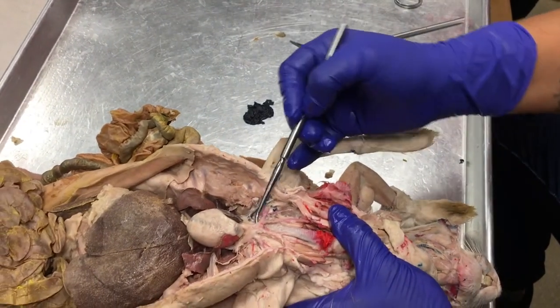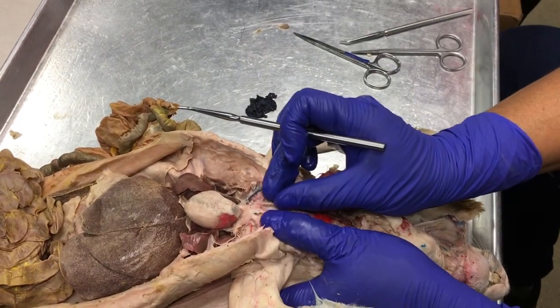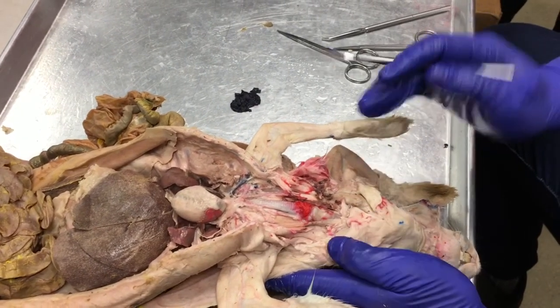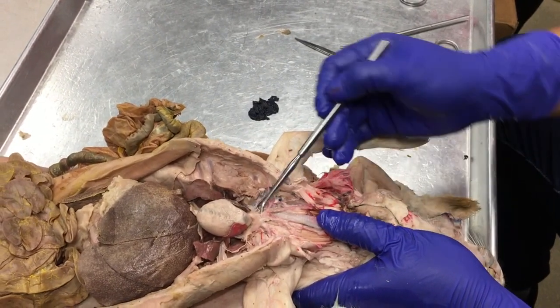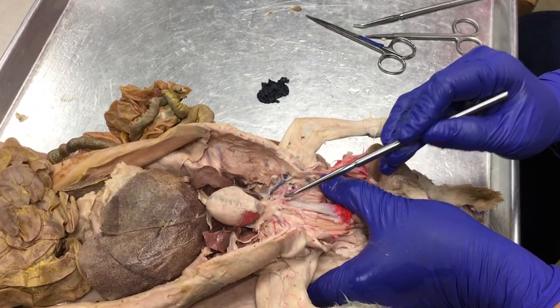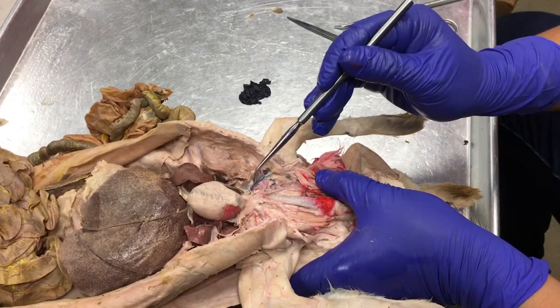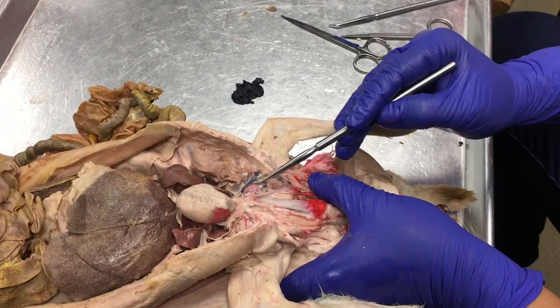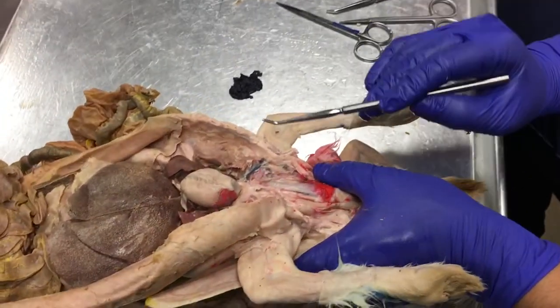Okay, so with our first branch off the arch of the aorta, we have the brachiocephalic trunk artery. It branches off into your common carotid arteries, which split into an internal and external carotid artery up near the masseter muscle. Another branch off of this brachiocephalic trunk artery is the right subclavian artery. The right subclavian artery has an anterior branch, the costocervical trunk artery, and then it has a vertebral artery branching posteriorly, and an internal mammary artery branching posterior laterally.